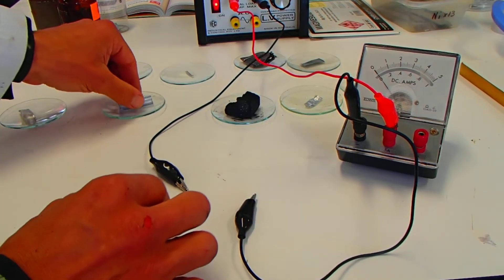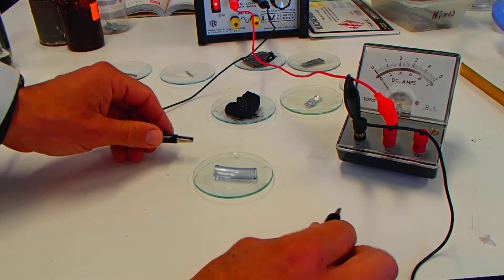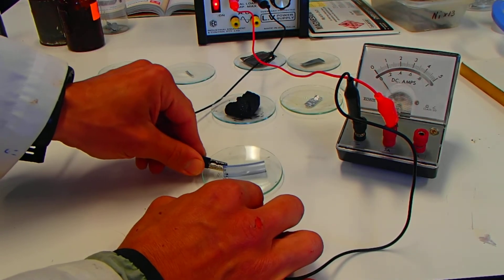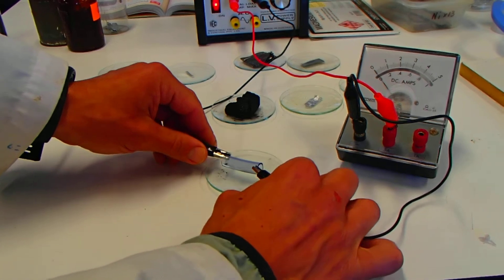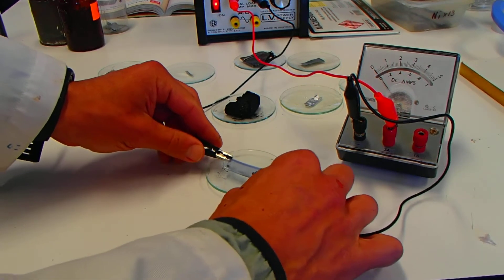Let's try the silicon sample. You might be able to predict as well what's going to happen. So I'll get one there and one there. Nothing for the silicon sample. Nothing on the ammeter there.